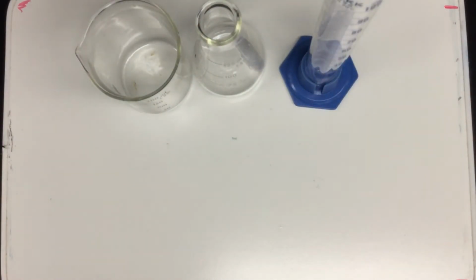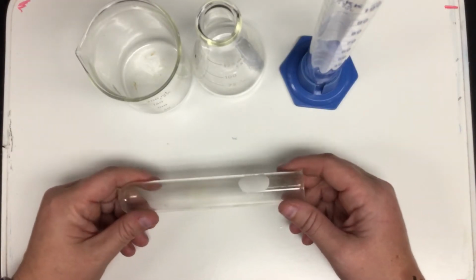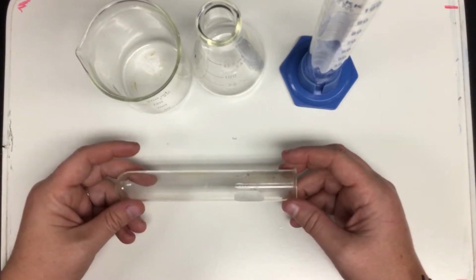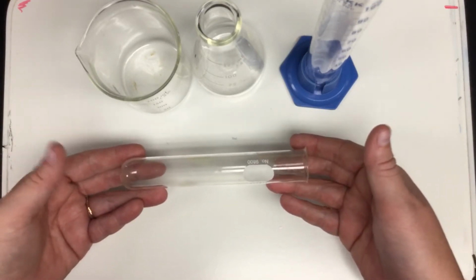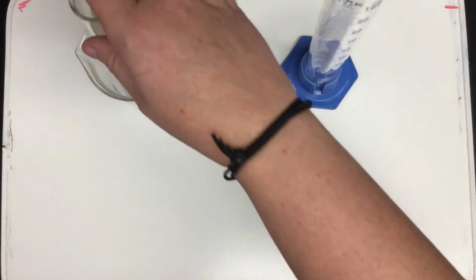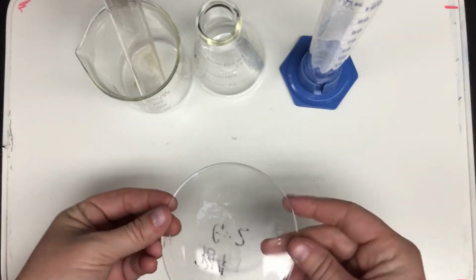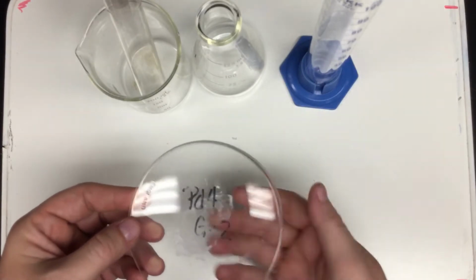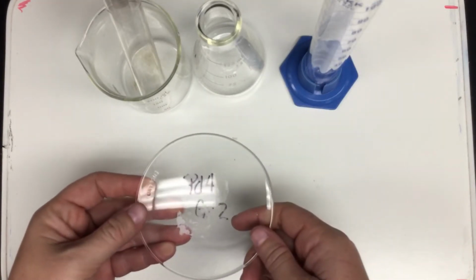The other pieces of glassware that you'll be looking at are your test tubes, which most of our test tubes do not have graduations, so they're not usually used to measure volume. They can be used to contain something to mass it on the balance, or they could also be used to heat substances. And we have our watch glass. The watch glass kind of looks like a huge contact lens. The watch glass is oftentimes used as kind of a lid for other things, or to hold things that are being massed at that time.